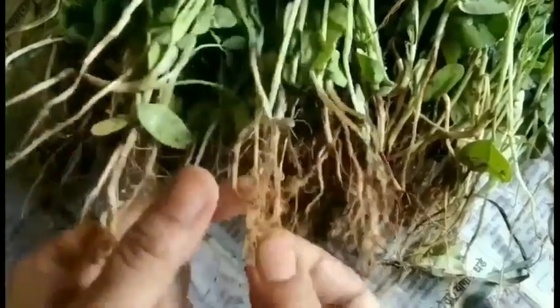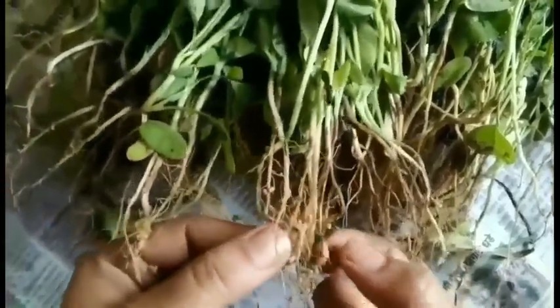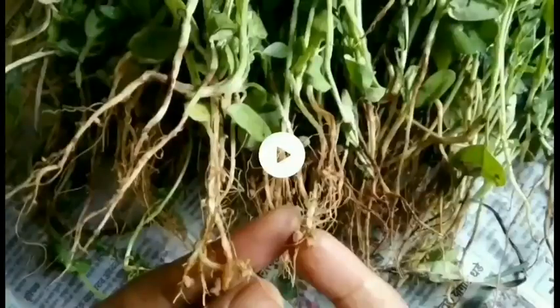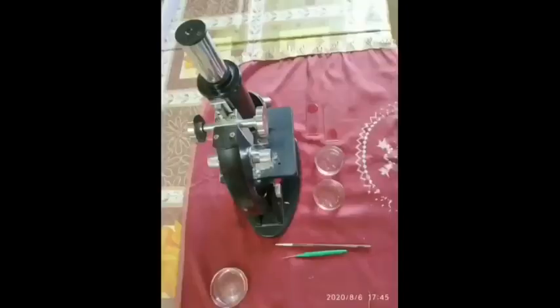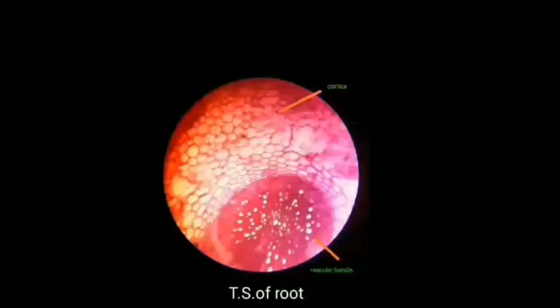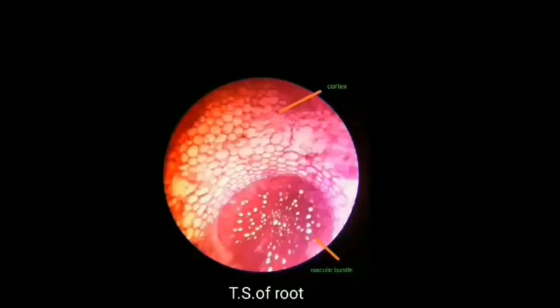To observe the anatomical features of root nodules, I used trigonella, that is the fenugreek plant. I made a temporary mounting slide with safranin. This is the section of the TS of root, where we can see the cortex as well as the vascular bundle.